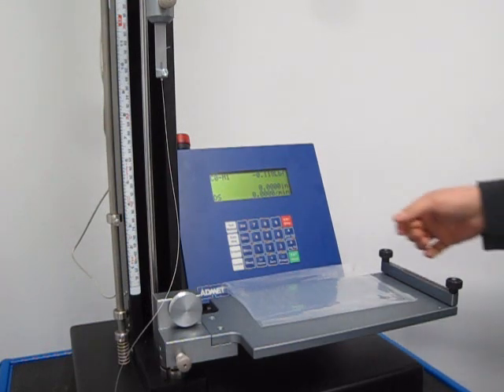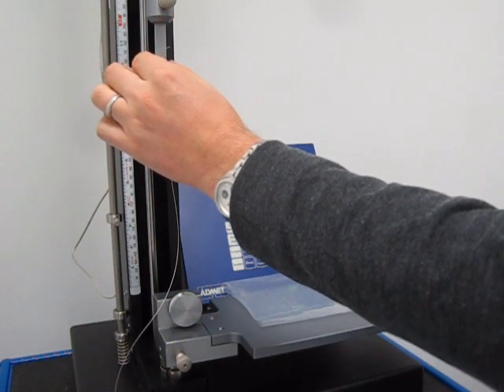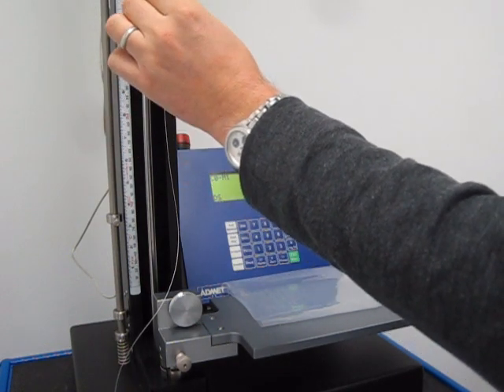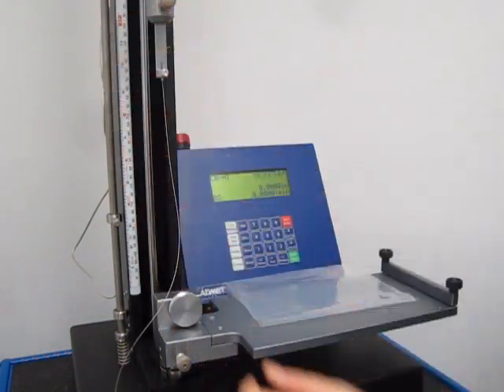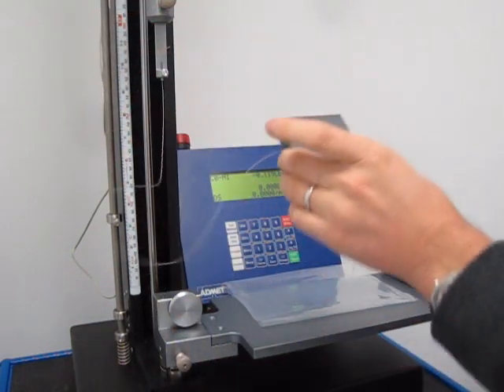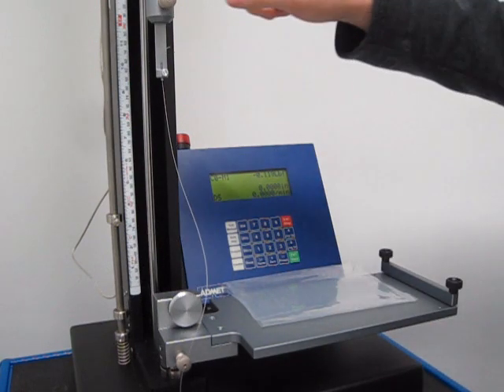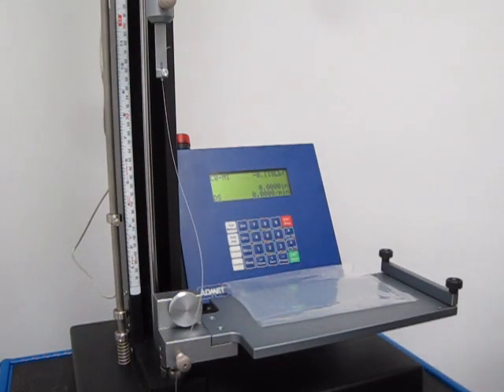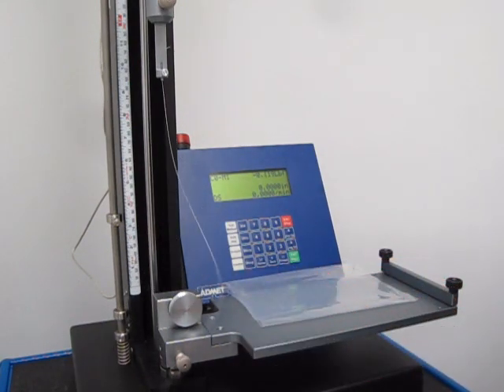The first thing you do is attach the top of the fixture to the sled. This goes to the load cell which is attached to the crosshead, so this will slide across during the test.